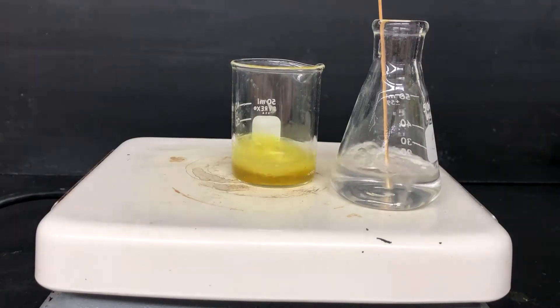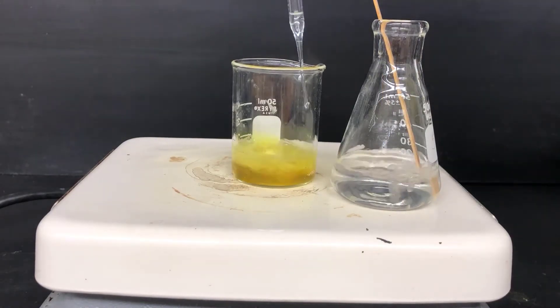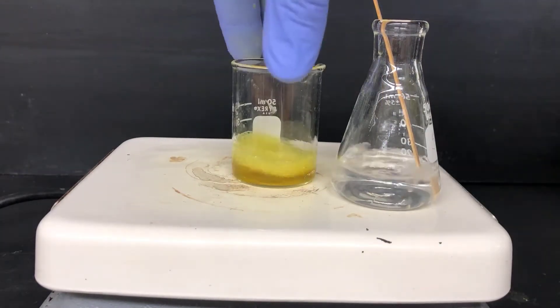Then you want to stop at the point where it's fully dissolved. I'm at that point now, so I'll take the beaker off and set it on the bench to cool.